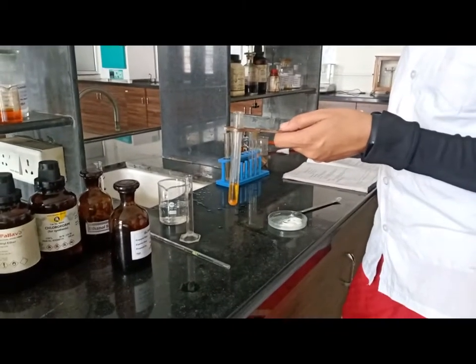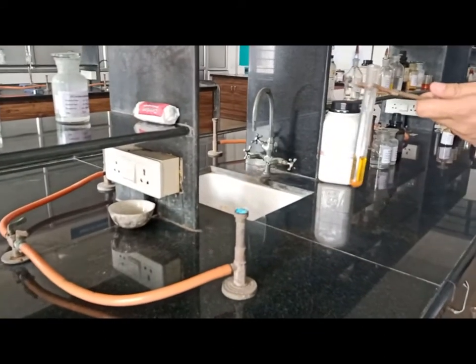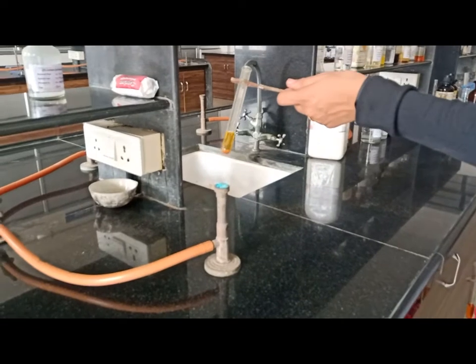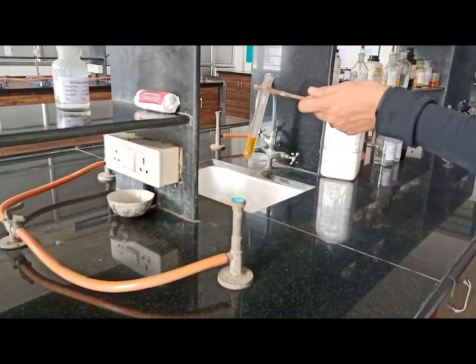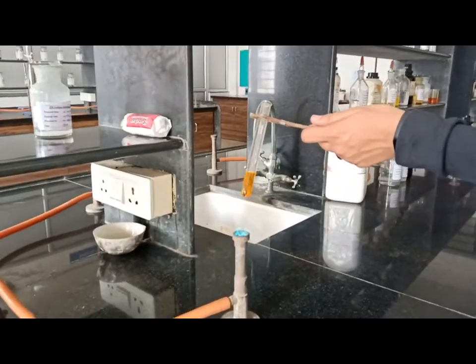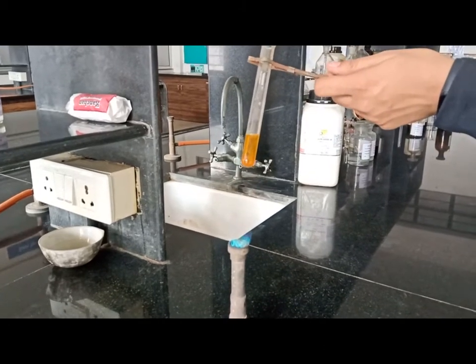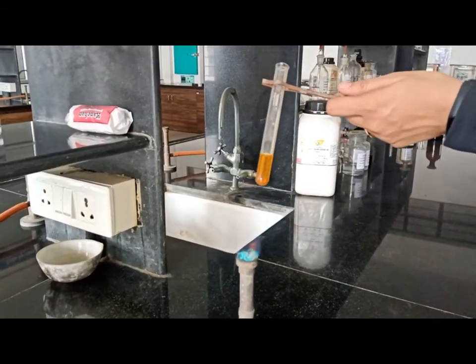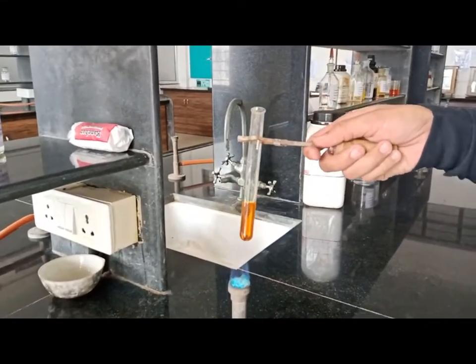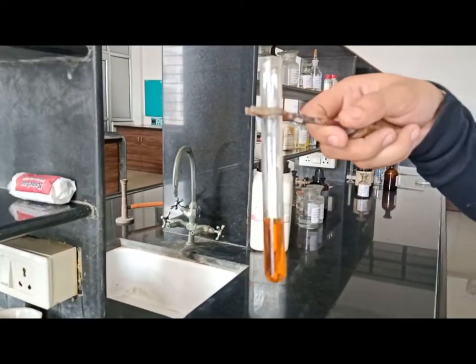After 2 minutes it becomes orange-yellow. We heat the orange-yellowish color precipitate and observe the changes. Gradually it gets converted — slightly orange, then into an orange-red precipitate.